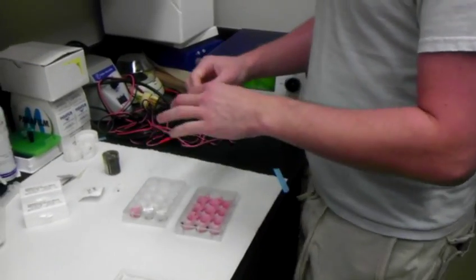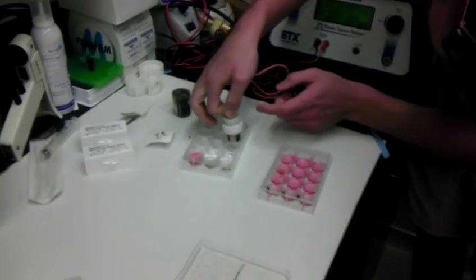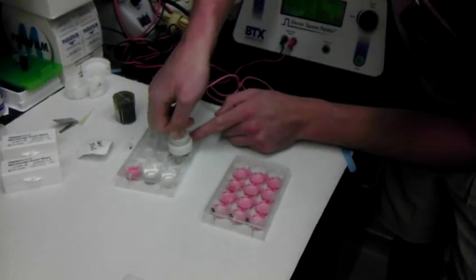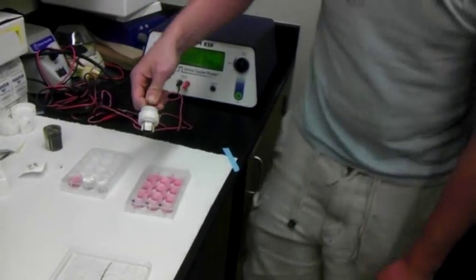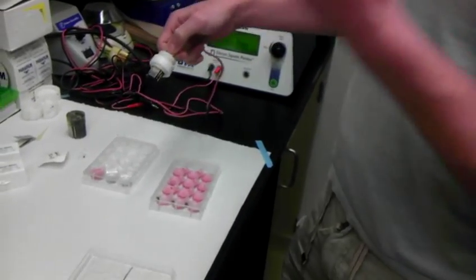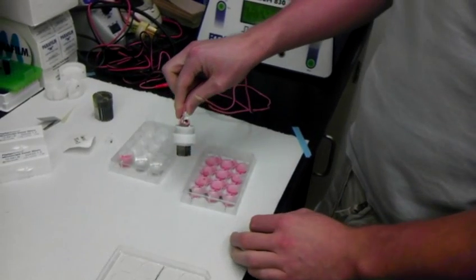I'm going to adjust the electrode. I'm going to actually set it up here first so I can see that it's not touching the ground, but it will be in the media. And this should be good where it's set now. You do not want the electrode to actually touch the surface of the gel because it will cause severe death to these cells.